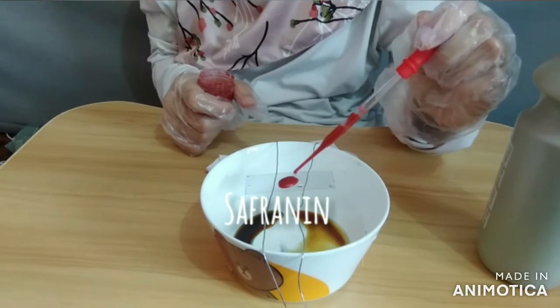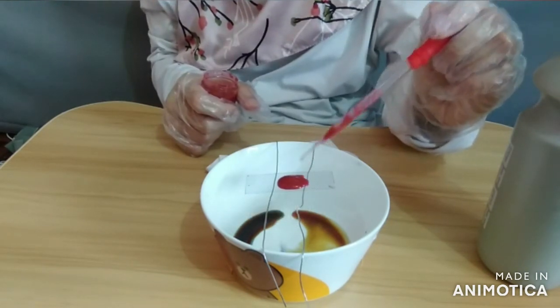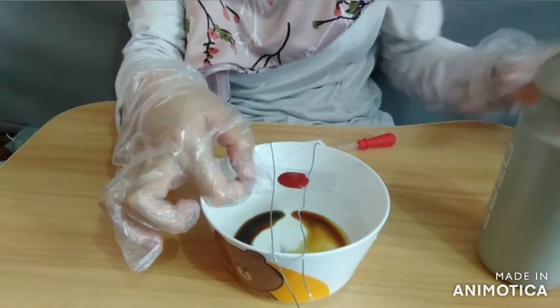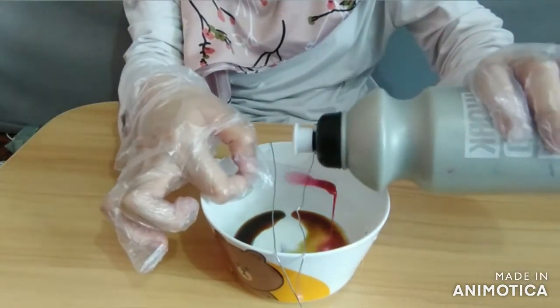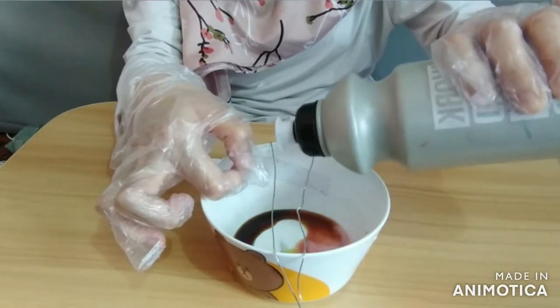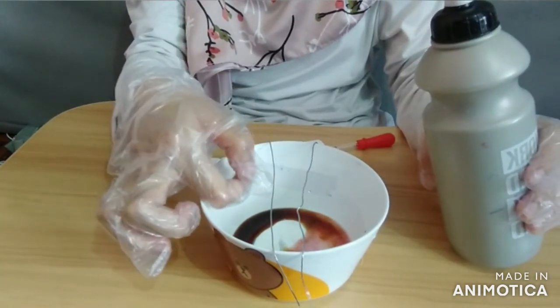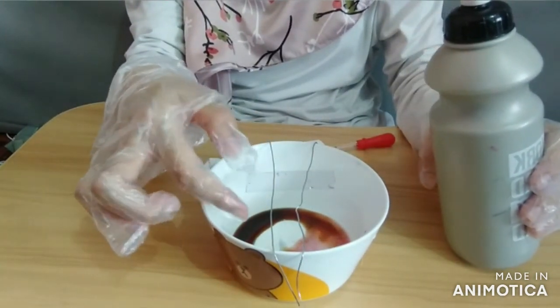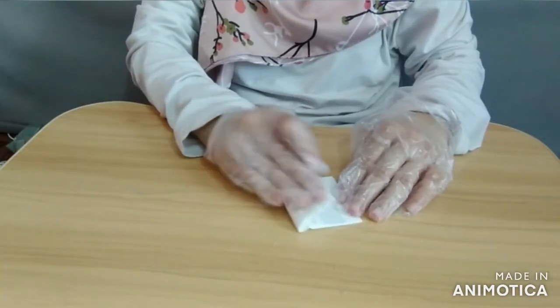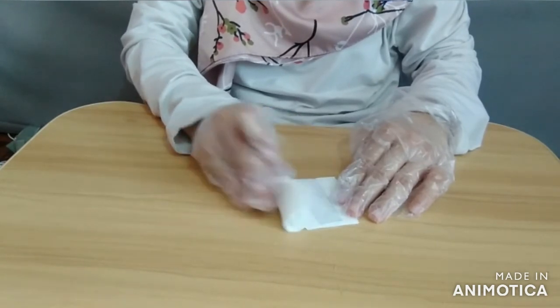Last but not least, counterstain the smears with safranin for 45 seconds and then gently wash off the stain with tap water. Blot dry the smears with bibulous paper, and finally you can examine the bacterial smears under oil immersion.